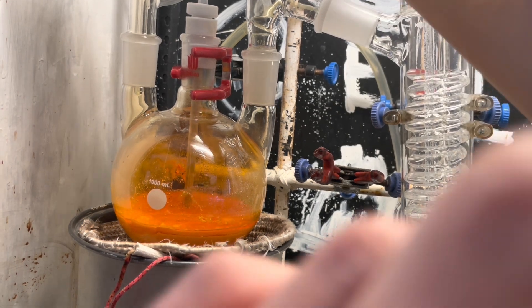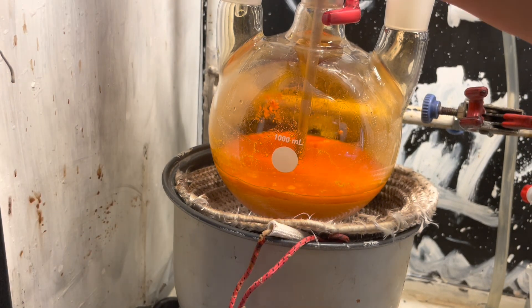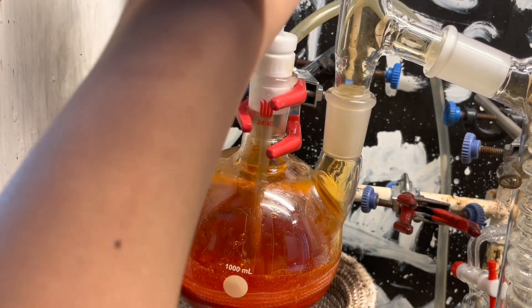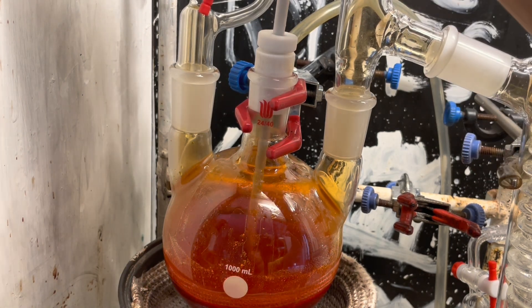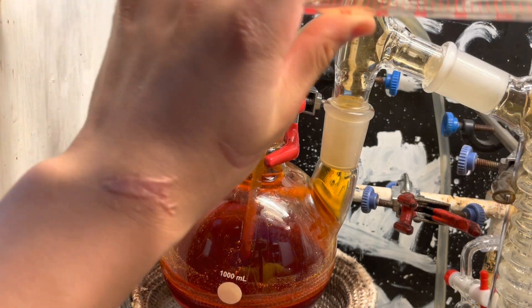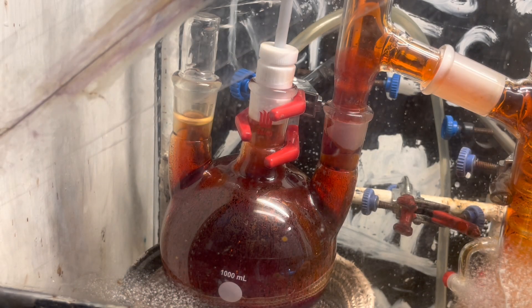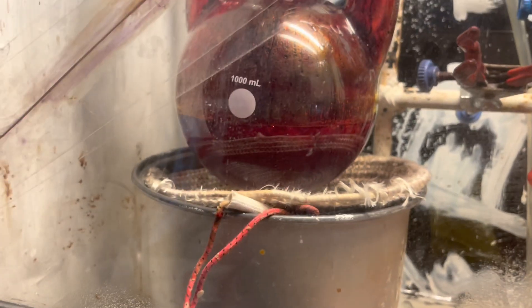You can see that the mixture has become quite chunky. It's time to add in the HCl - open it up, get a bit of HCl in there, give it a good stir. So TCCA plus HCl actually gets colder, which means that the displacement reaction of the chlorine with the potassium bromide is actually exothermic. You can actually see some bromine already boiling - it's really boiling itself now. Blood red.